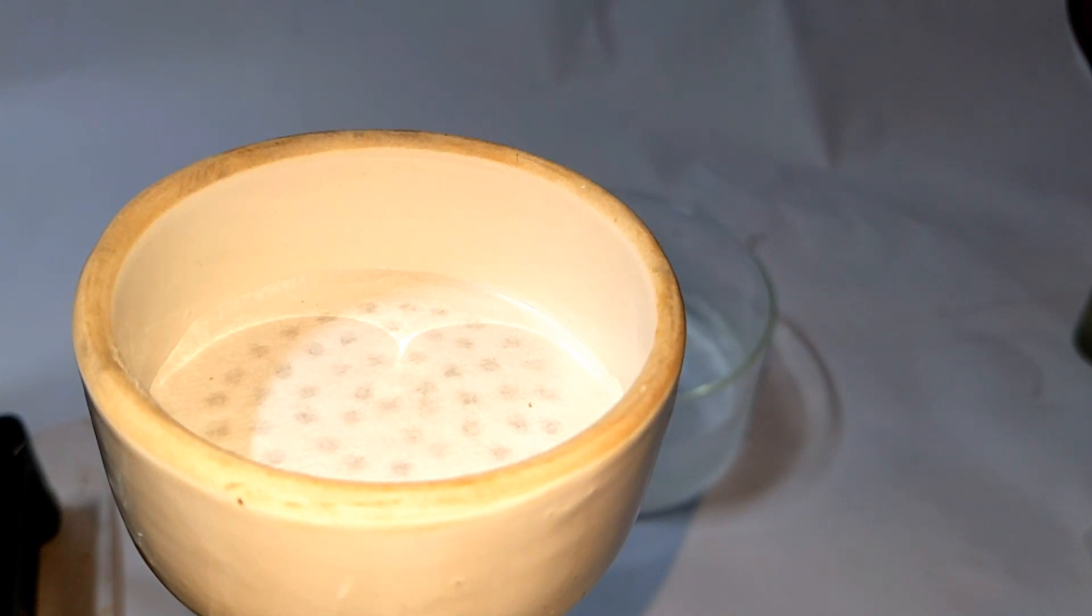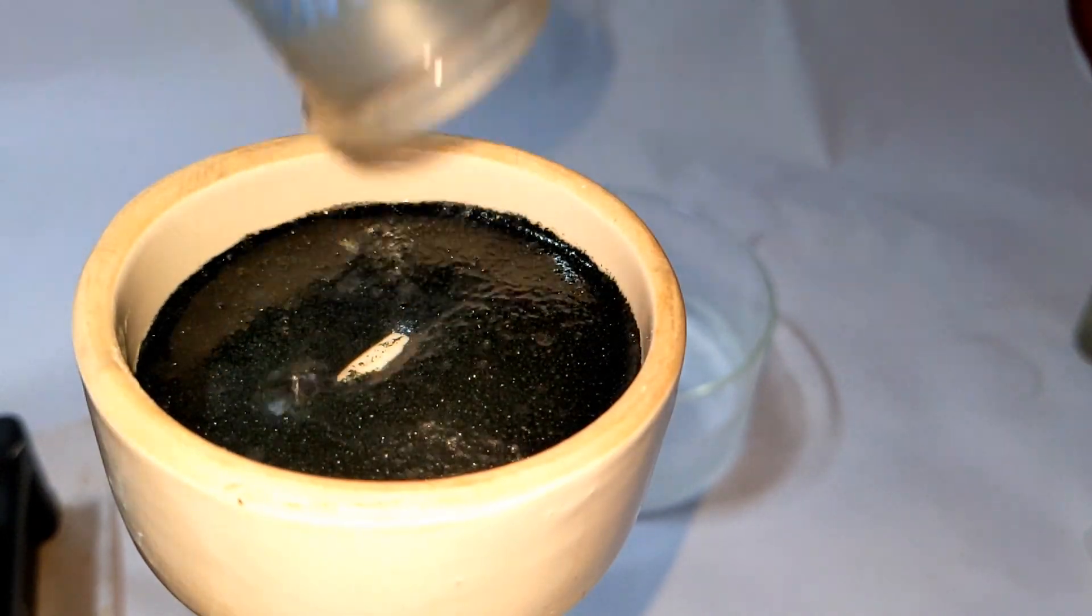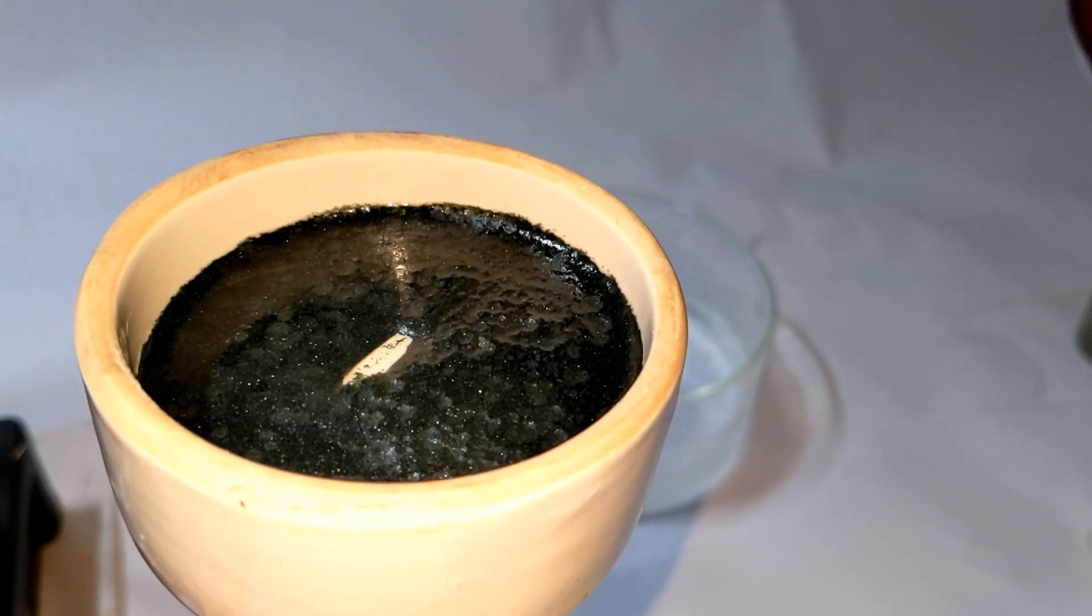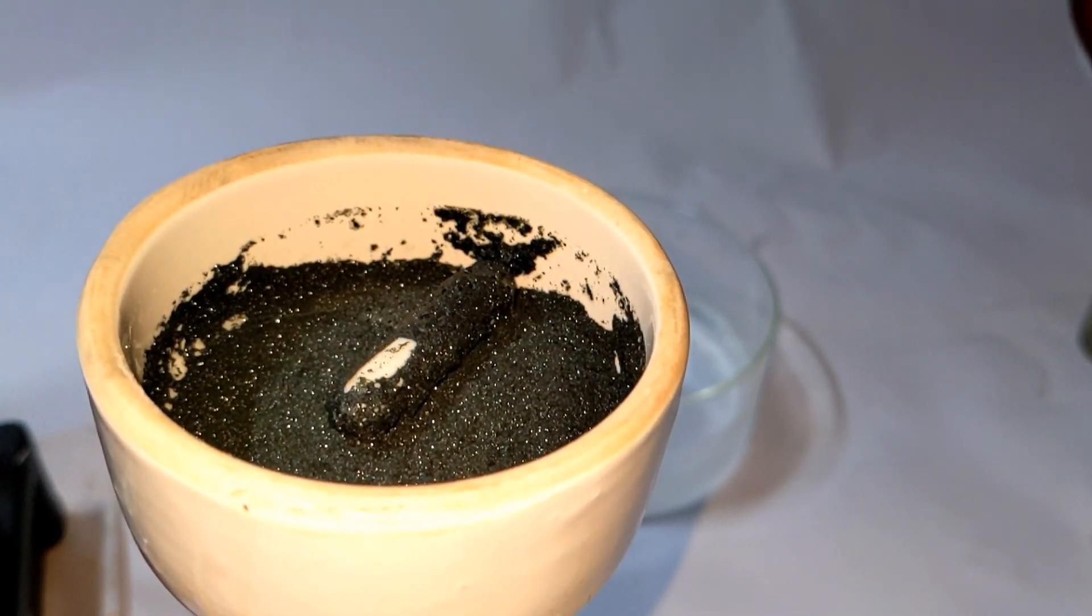After about 4 hours, the solution was taken for filtration. I am using a vacuum filtration method using a Buechner funnel. You can also use a simple gravity filtration method here.